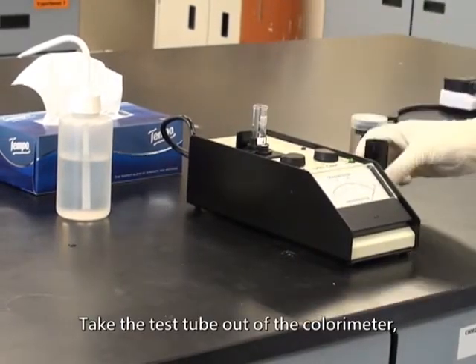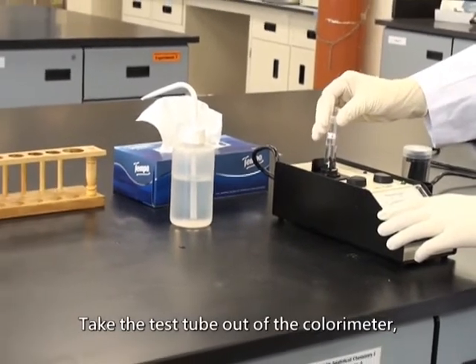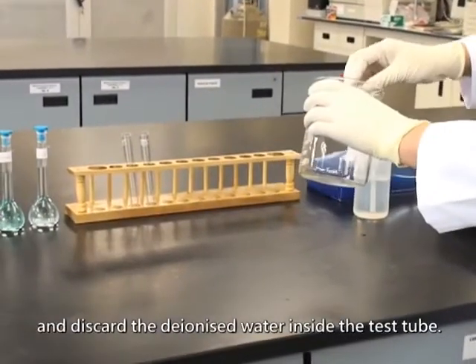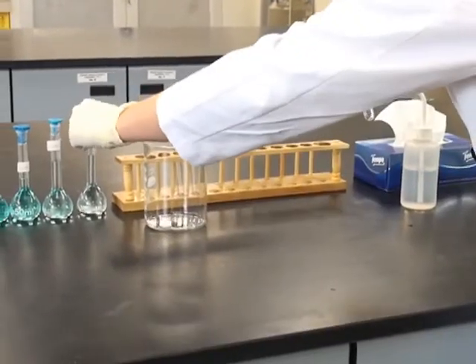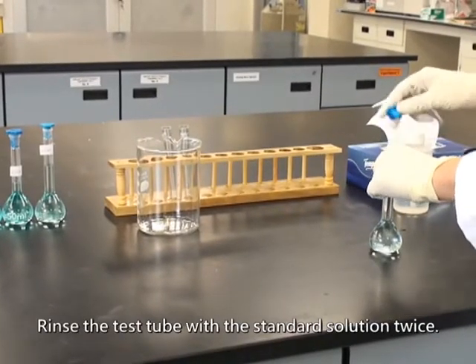Take the test tube out of the colorimeter, and discard the deionized water inside the test tube. Rinse the test tube with a standard solution twice.